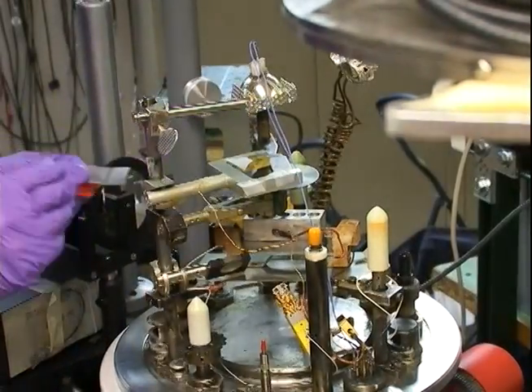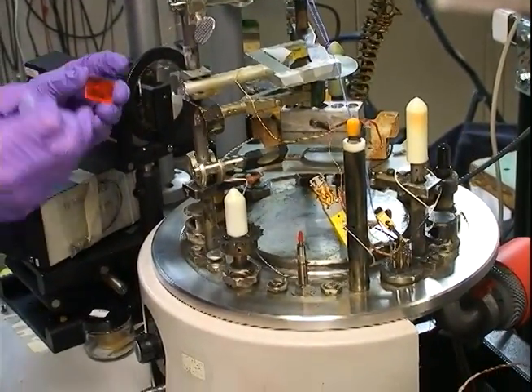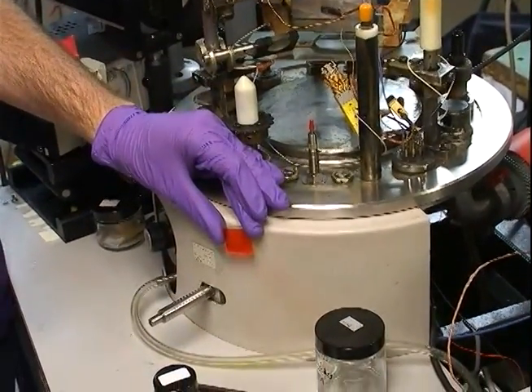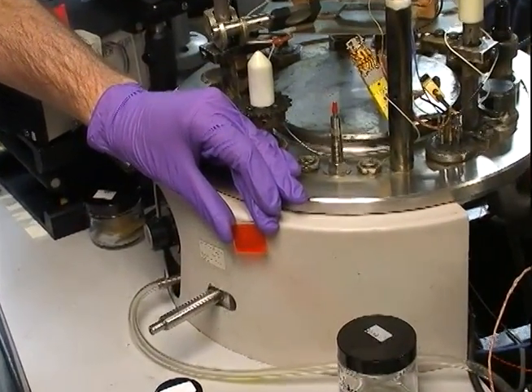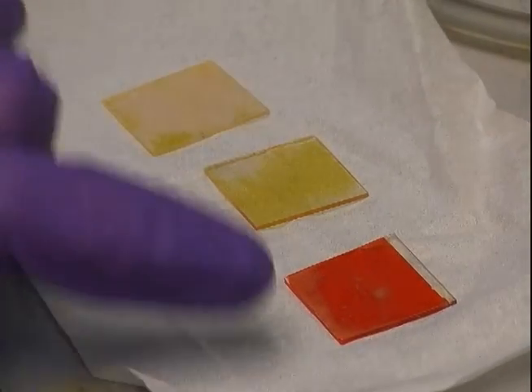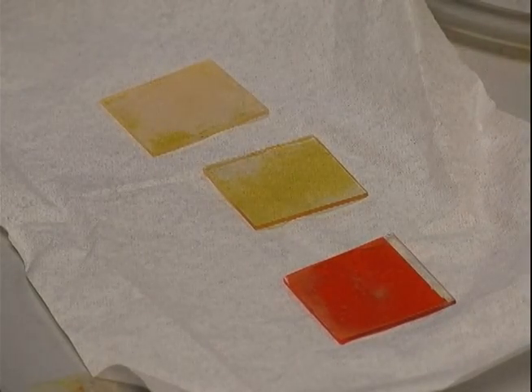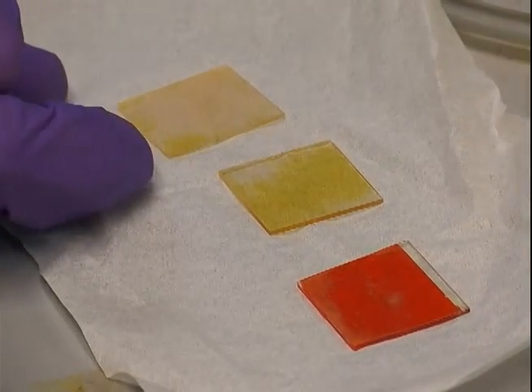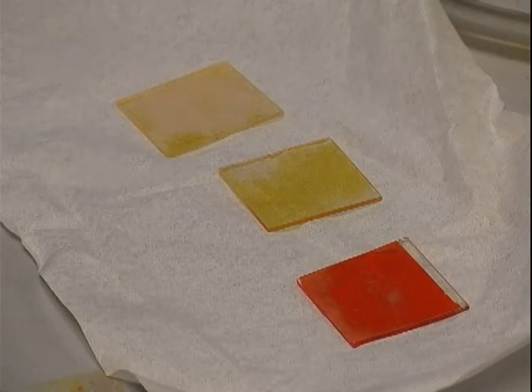Now that you have your substrate deposited, you have a chemical on the glass like this. Depending on how long you have it going, you can get various thicknesses. As you can see here, these are three different thicknesses so you can see three different colors. This one is closer to about two microns thick; this one is as low as 10 to 20 nanometers.